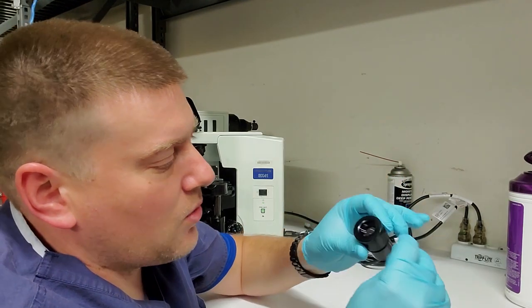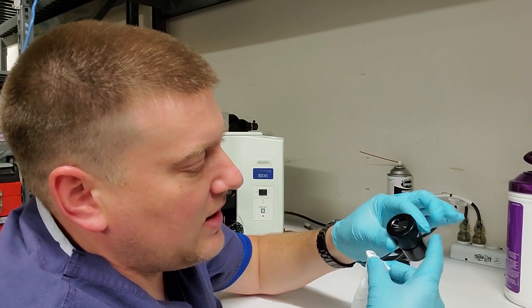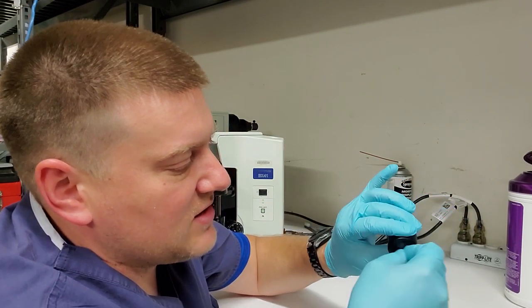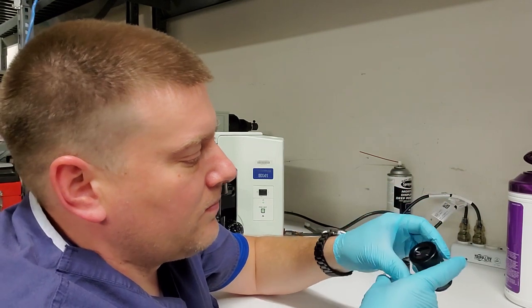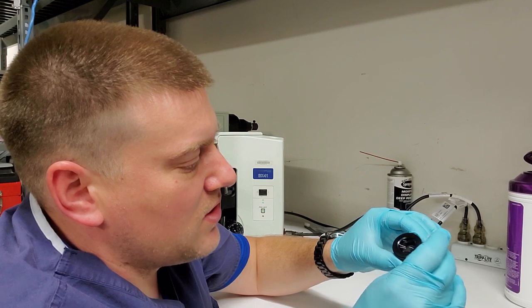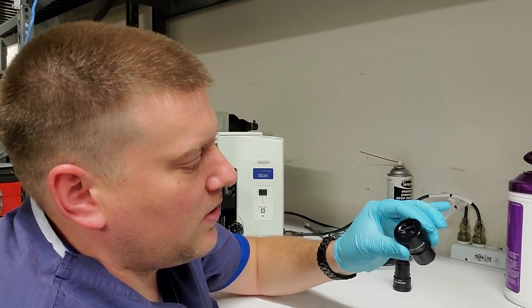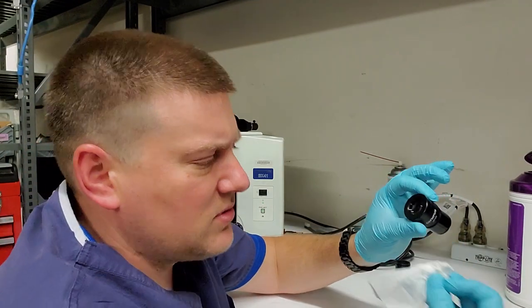And what I'll do is I'll wipe it to clean it, and then I'll rotate it in the sunlight and see if there's any debris. Make sure that there's no contamination on there, okay? Perfect. These Zeiss wipes do such a good job.